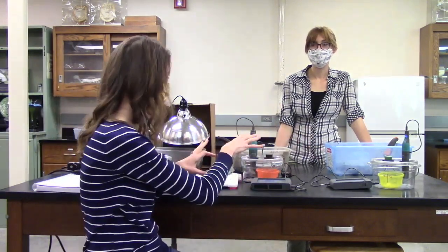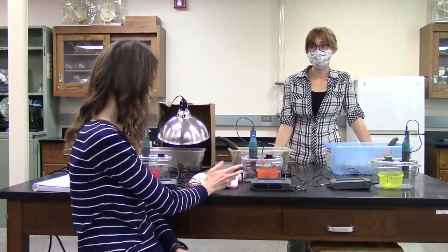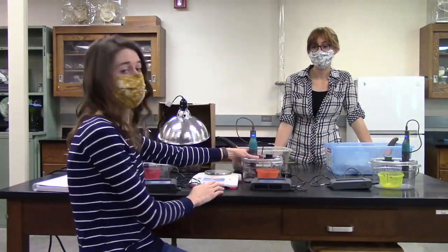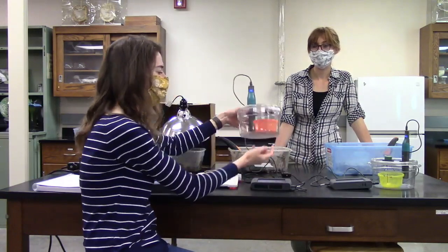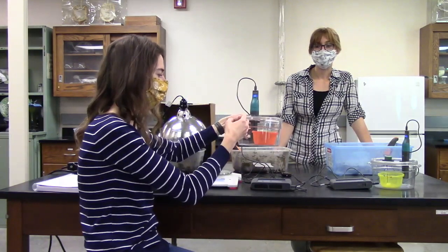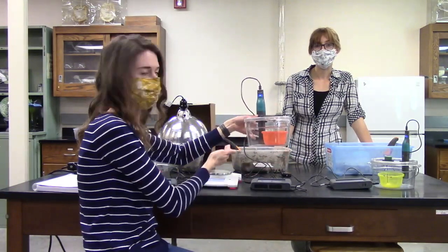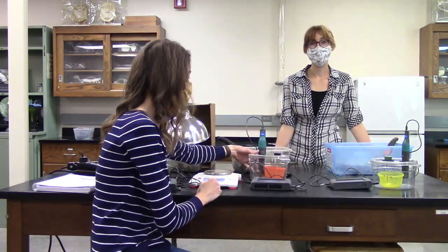So we'll go ahead and get that started, get our samples measured out. We have one scale up here, and we're going to measure 100 grams of soil into each of our chambers. What we usually tell you if you were in the lab is we want to make sure that our CO2 sensor is not sticking inside of our little Ziploc container in here, because we don't want to be covering up any of that CO2 sensor. So we're always careful about making sure that our soil is kept separate from our CO2 sensor. That's why we have a container inside of a container for this setup. So we'll do that, and then we'll show you the results at the end of it.